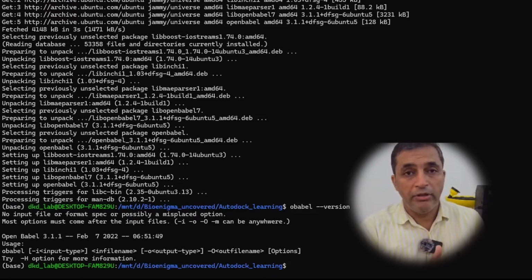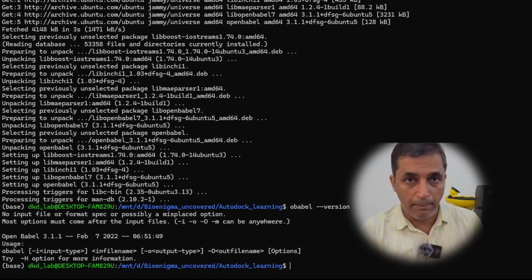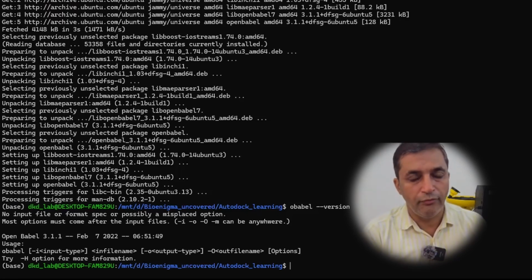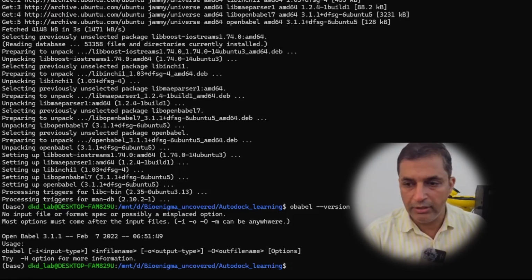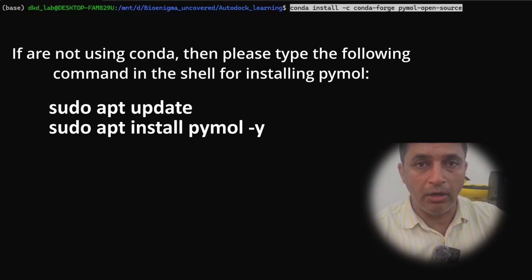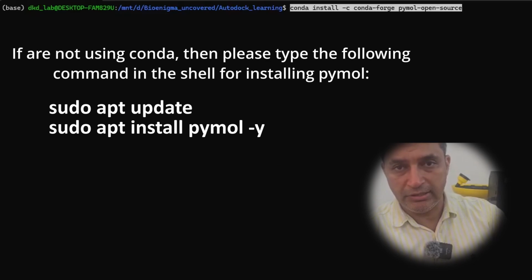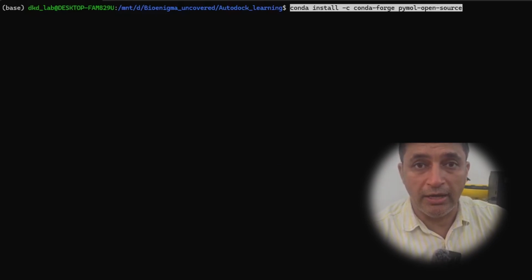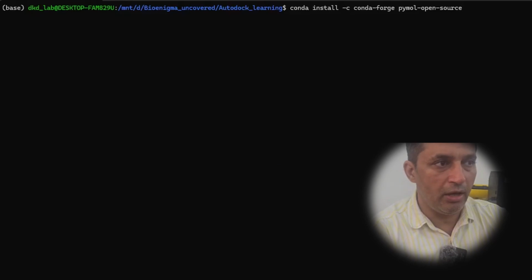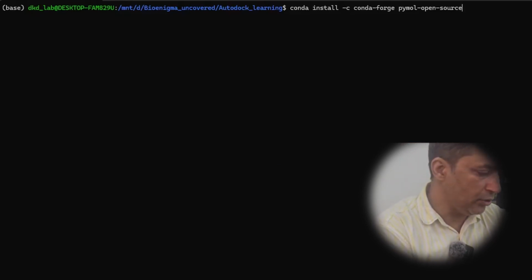Moving forward, now in the fourth step, we are going to install PyMOL into our computer system. So that installation is also fairly simple and straightforward. For installing PyMOL, I'm going to type the command conda space install -c, which means channel, conda-forge pymol-open-source. Since I am using a conda environment, I'm going to use this command: conda install -c conda-forge pymol-open-source.